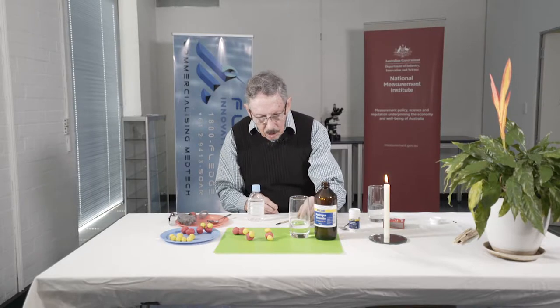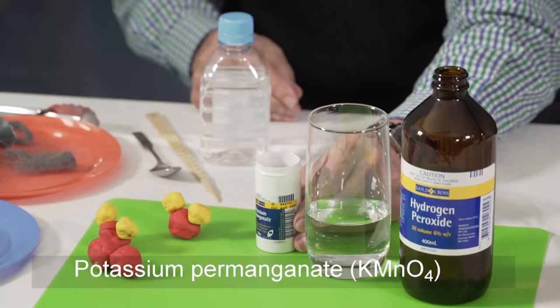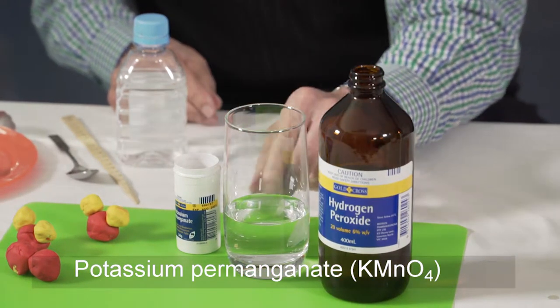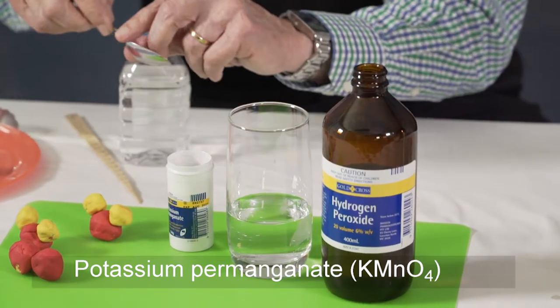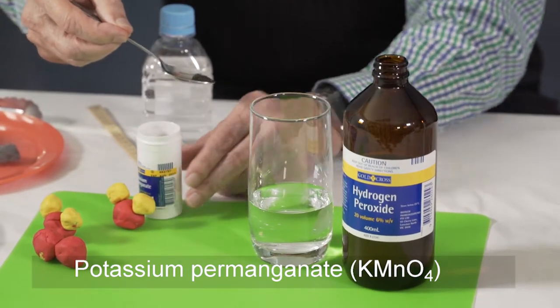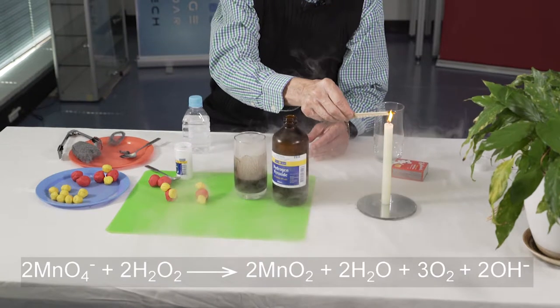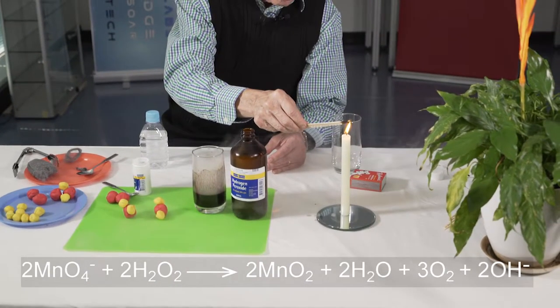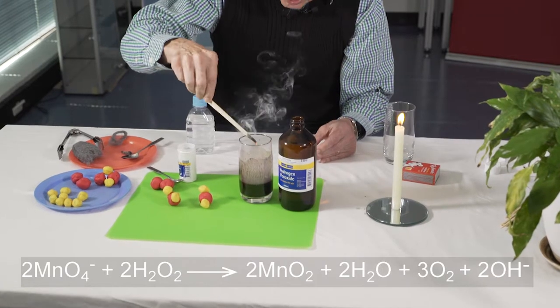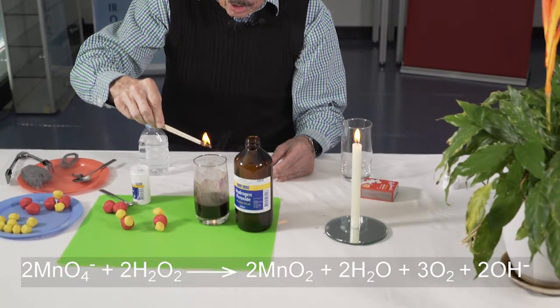You can turn hydrogen peroxide into water and oxygen by adding chemicals. One chemical you can add is potassium permanganate, or Condy's crystals. This is another disinfectant, also sometimes used to treat snake bites. We add a small amount and should produce some oxygen — you'll notice it as bubbles. A small amount of potassium permanganate into the glass, and there's a gas being produced. If I light a wooden splint — an old broken ruler — and plunge it into the oxygen, it glows more brightly. If I blow it out, it rekindles from glowing wood to burning wood. That's one of the things oxygen can do: it can make things burn.